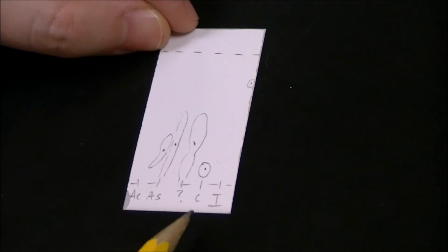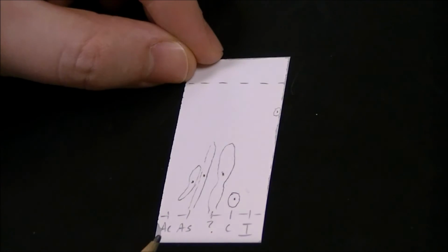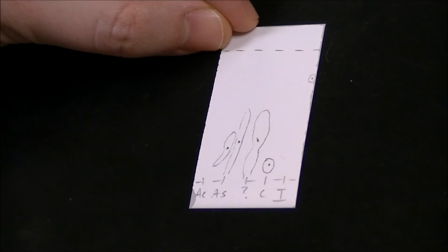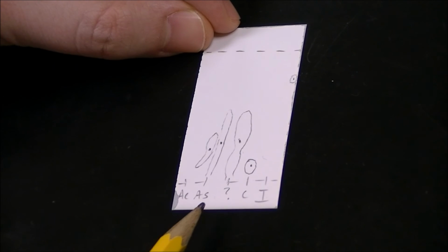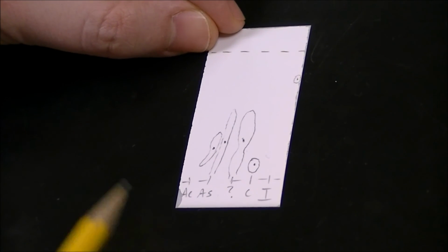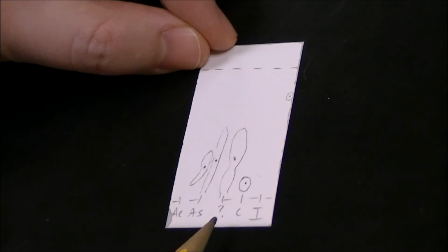Okay, now we're going to identify our unknown. How you do that is you look at each of these lanes that you've circled and the shape of the lane, and you look at your unknown and you say, which of these added together would create the shape that looks a little bit like our unknown lane? Judging from ours, it looks like we've got acetaminophen, aspirin, and caffeine within this lane. Looking at the table in the lab procedures, it looks like we have Excedrin.